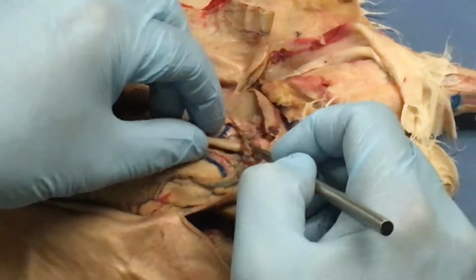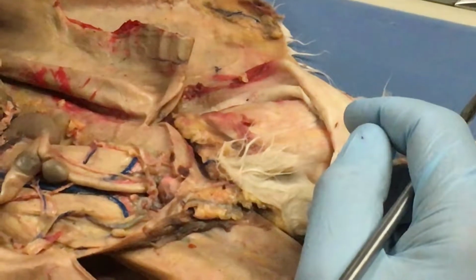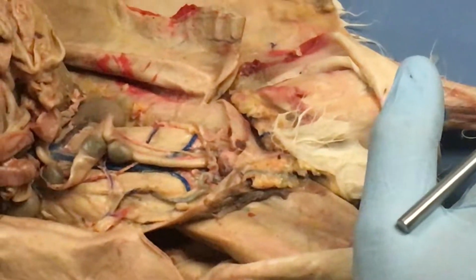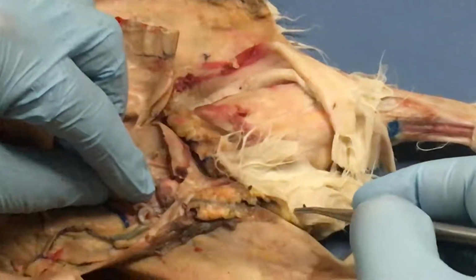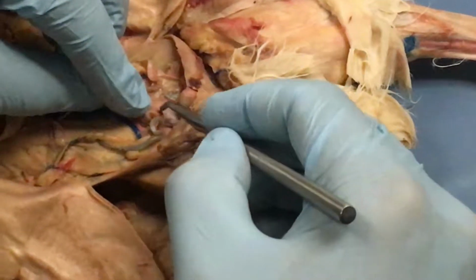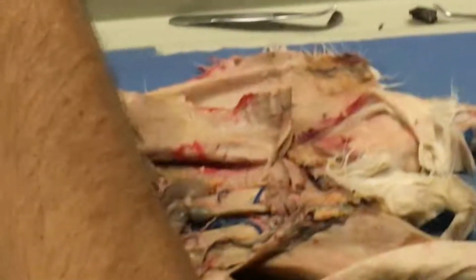And then the vagina simply is, and a lot of people get very, very confused about this. No politically correct way to say this. Rabbits have a huge vagina, okay, so do cats. The vagina simply is where the two uterine horns come together, and so the vagina is way up here, and then it comes all the way down here. Even in an immature one, we can see where the uterine horns come together right here. Each side, the uterine horn comes together, so it forms kind of like a Y. And then the bottom part of the Y, this part of the Y, is the vagina.